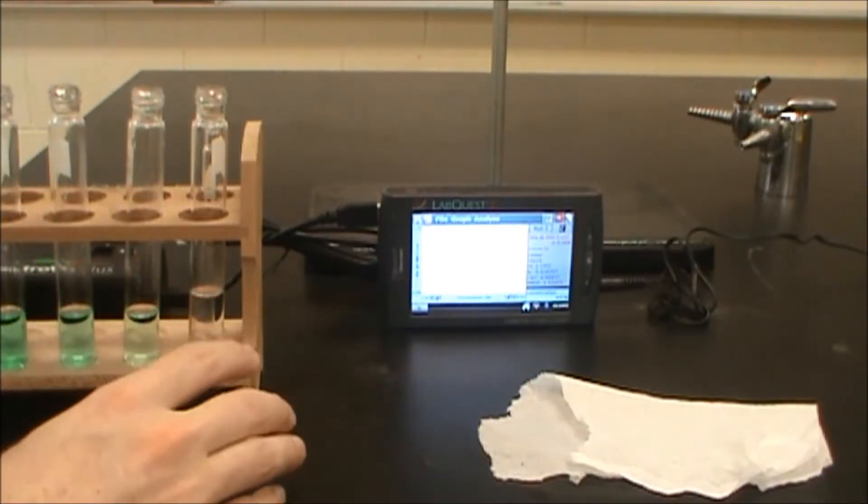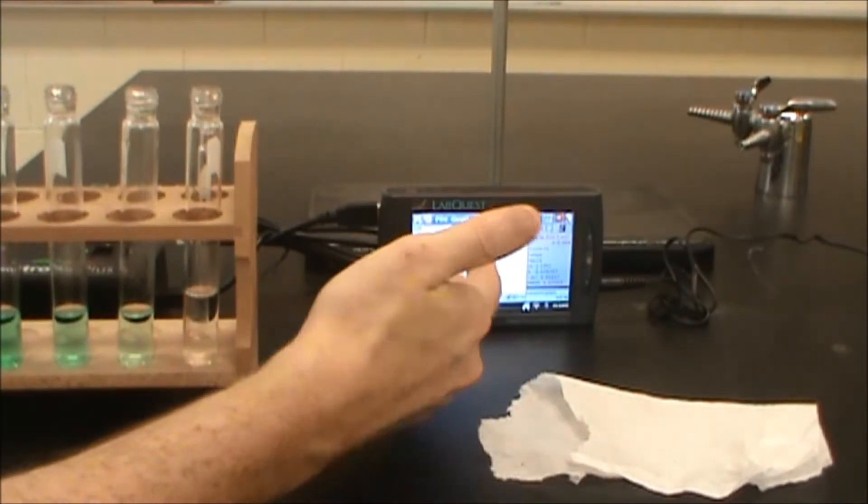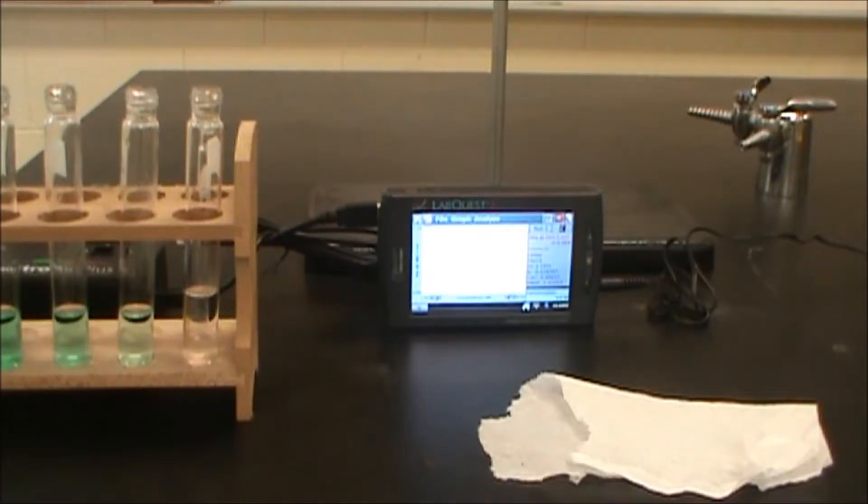Here I'm going to show you the Beer's Law Lab, and I'm going to show you how to construct a calibration curve like this using the LabQuest 2.